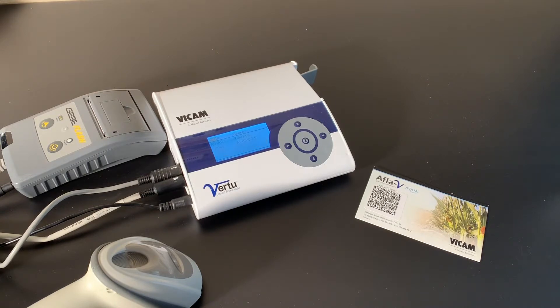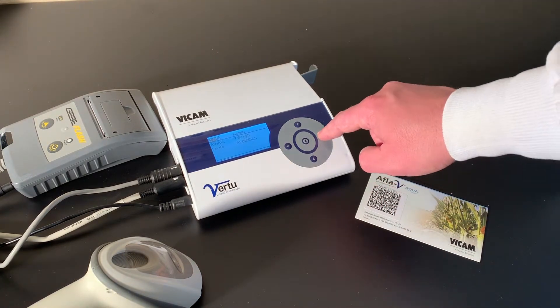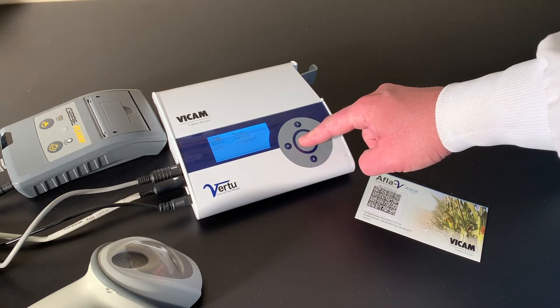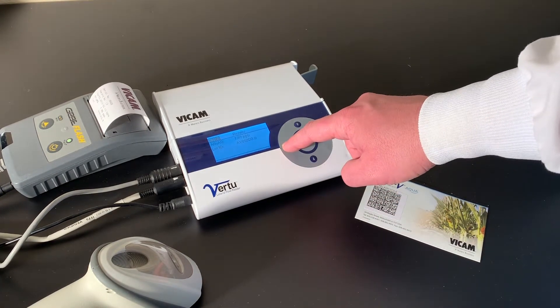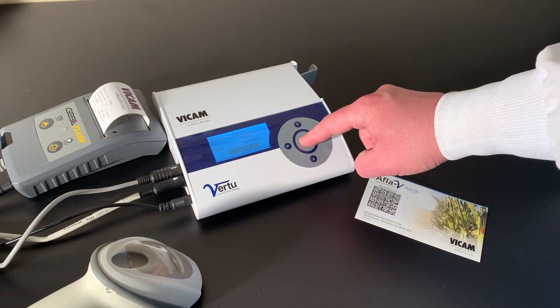The results are shown on the screen. Press the right arrow to move to P. Press the center button to print your results. Press the left arrow to move to NT for the next test, then press the center button.